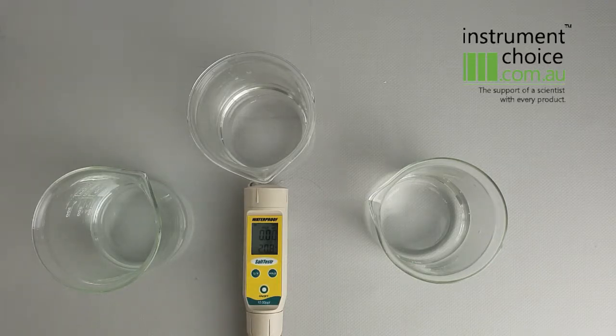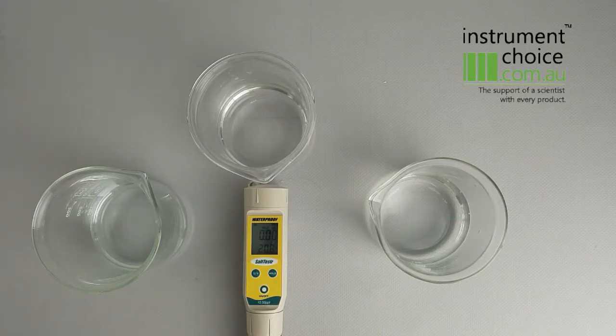In the video today I'm going to give a quick coverage of how to initially calibrate the meter so that you can then go about doing your readings.